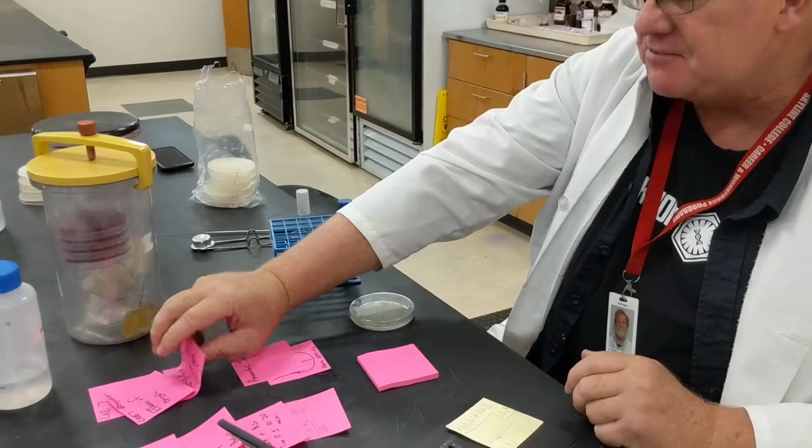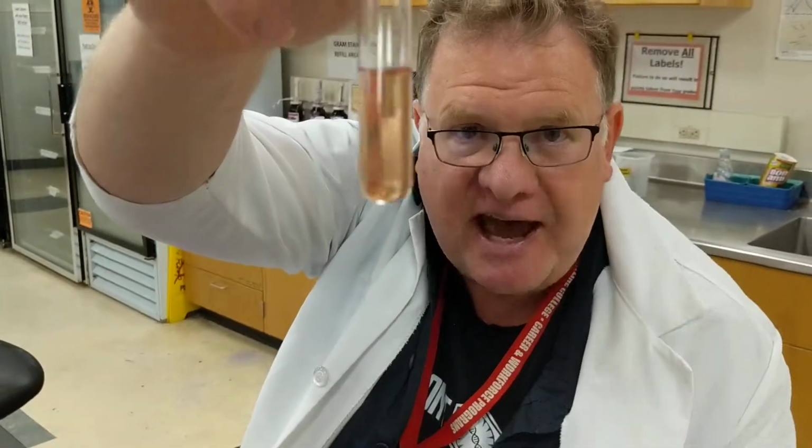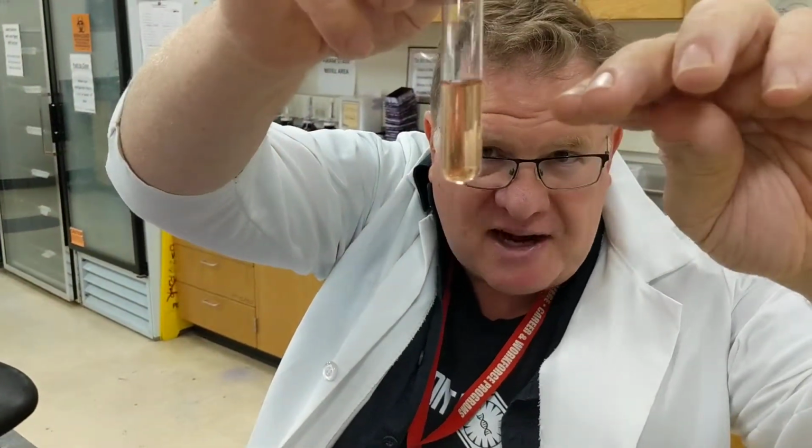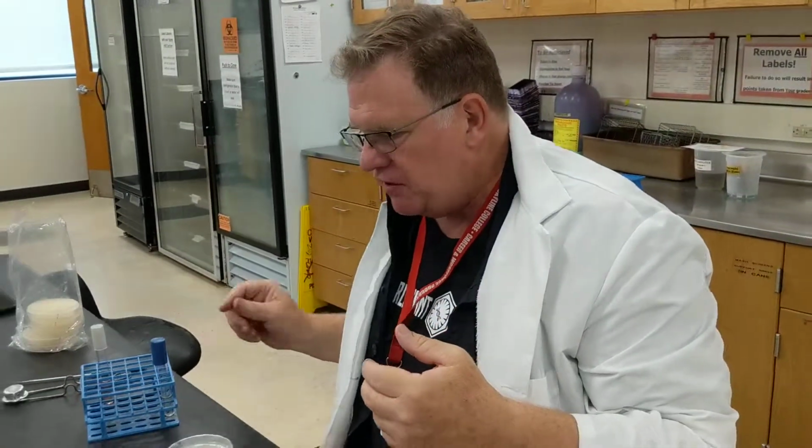We are using a substance called thioglycolate, and what's really interesting is this structure right in here. This is what we call a stab, which actually absorbs oxygen. So you're going to have a gradient of oxygen, high oxygen on top and low oxygen at the bottom. And this gives you an idea of where your microorganism is going to be.